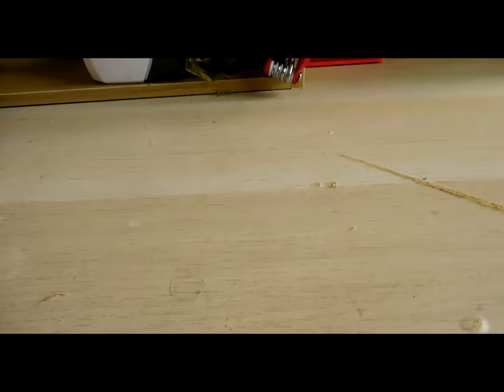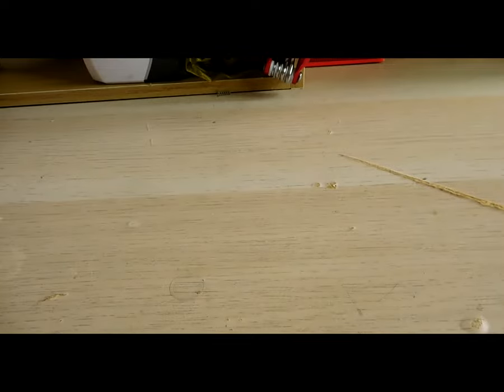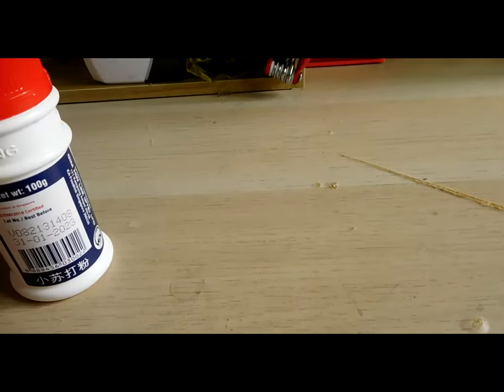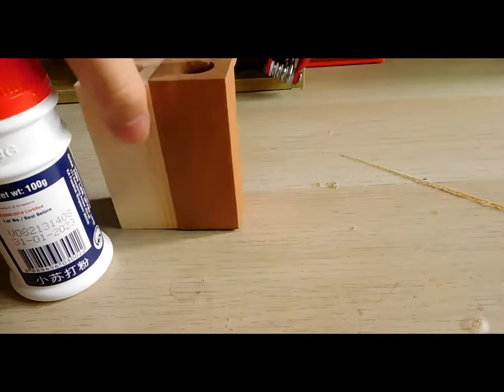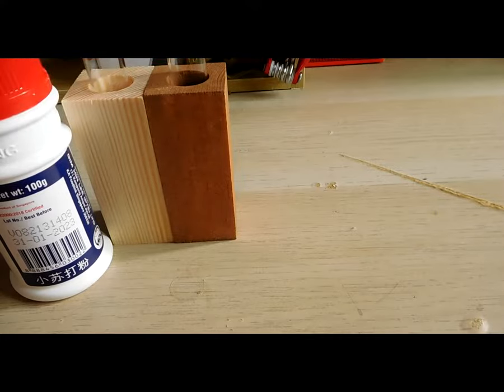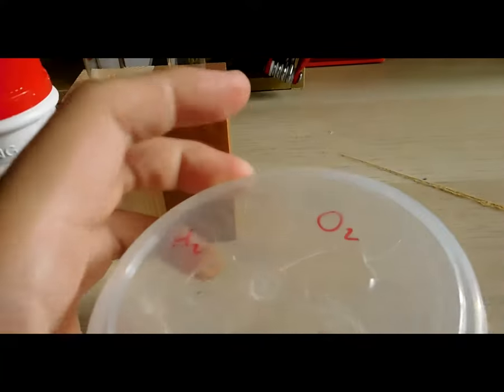So what do you need? Simple. Firstly you will need bicarbonate soda or sodium hydrogen carbonate, two test tubes, and this setup right here to hold the test tubes and contain all the water.